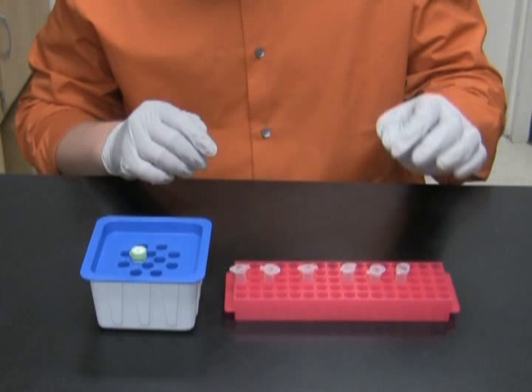I'm going to set up two reactions: one with vector and insert, and one with vector alone for control.